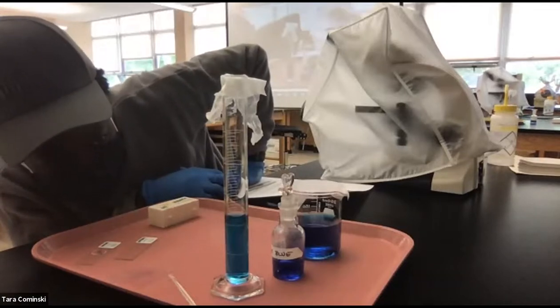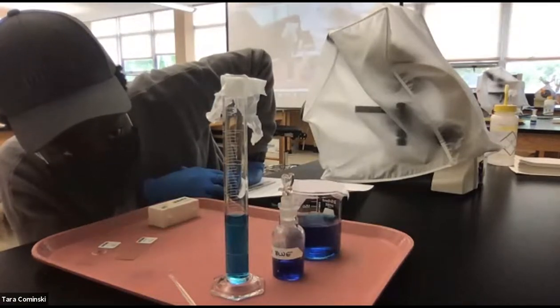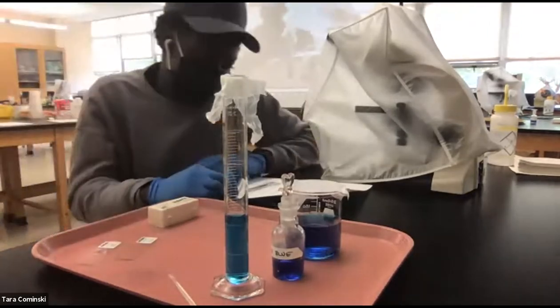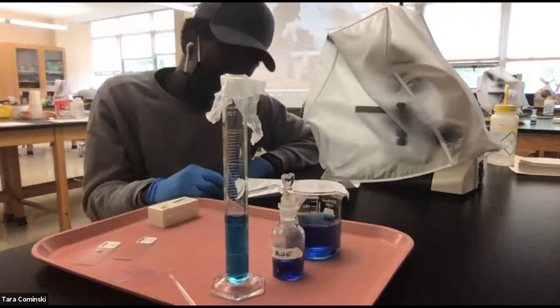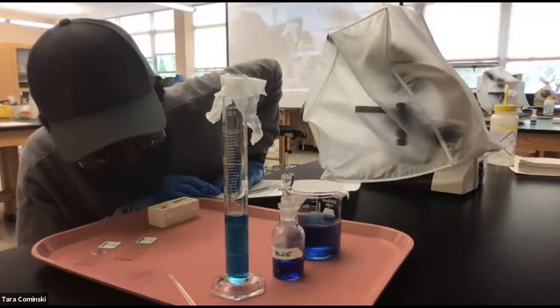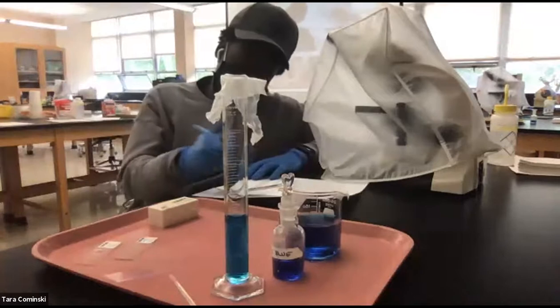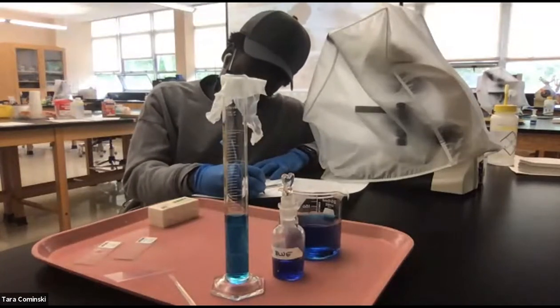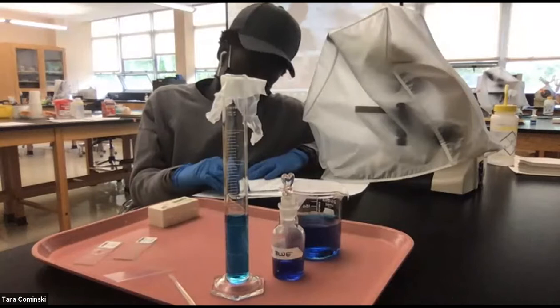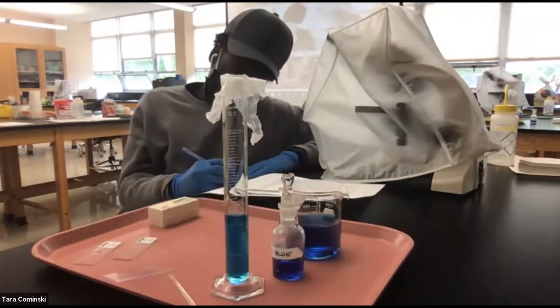If I'm not mistaken, it's like 28. It's going to 29, I believe. Okay, yeah, it looks like that. I would say 28. All right, so 28 what? What's yours there, Sting? Milliliters? Yep, 22. So 22 milliliters. Write down what yours is. So Sting's was 22 milliliters and Erica's was 28 milliliters.